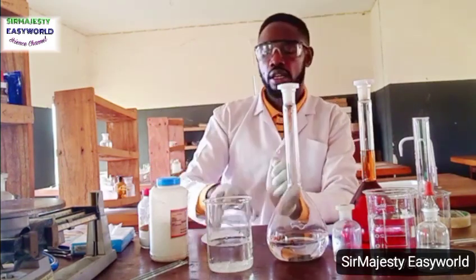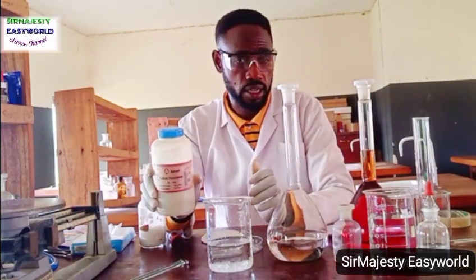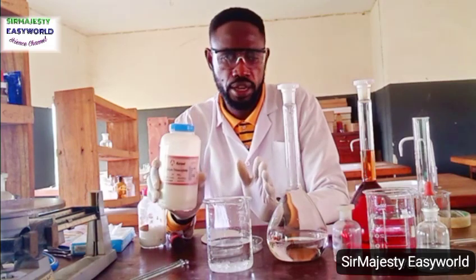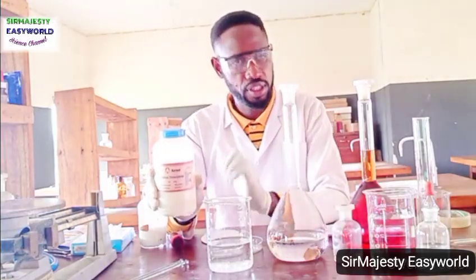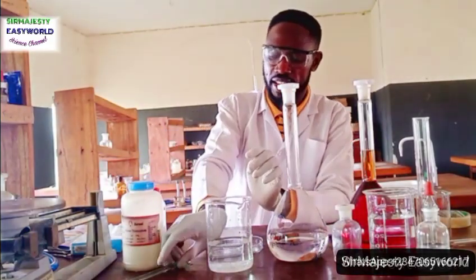And again, this sodium thiosulphate is efflorescent, and it is also sensitive to the environment, just like iodine, but it's more stable, far more stable than iodine. So you have to check whether the one you are using is up to pentahydrate. If not, there will be a big error for your school. So you buy from me if you need an accurate result. Thank you. So I've added this here.